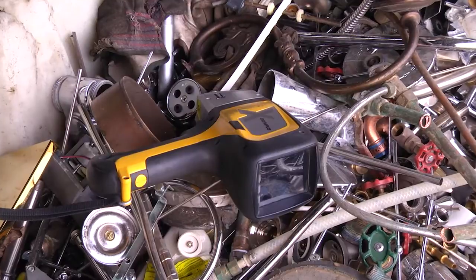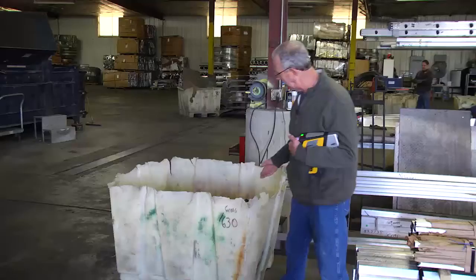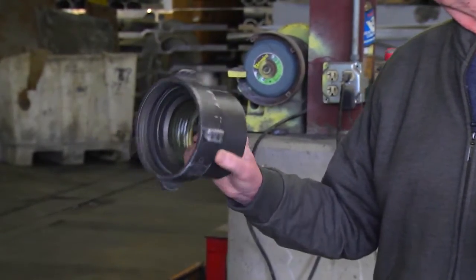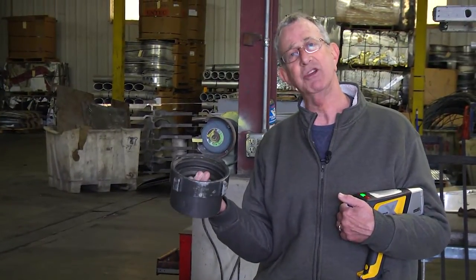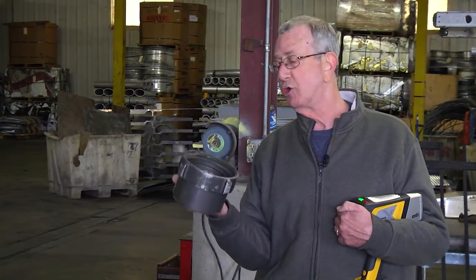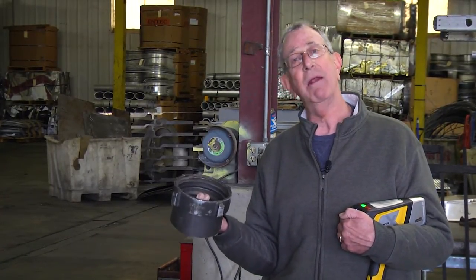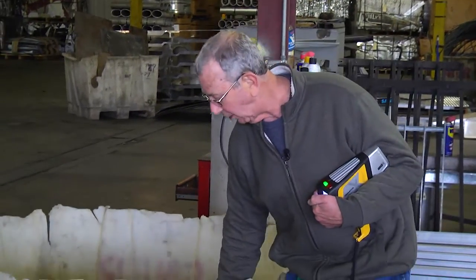Sometimes we'll receive plastic containers of smaller items. A lot of times people can mistake this for a casting, but upon closer verification by the Delta analyzer, this is an extruded alloy. So if we bought it for a cast alloy, we can definitely upgrade it for maybe one and a half times the price for an extruded alloy.